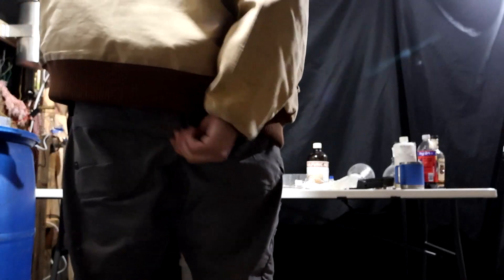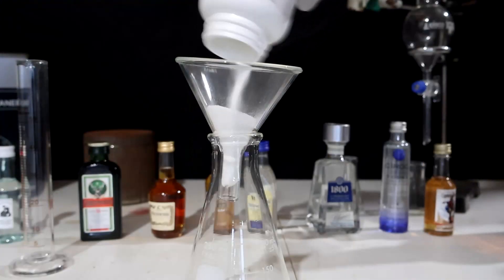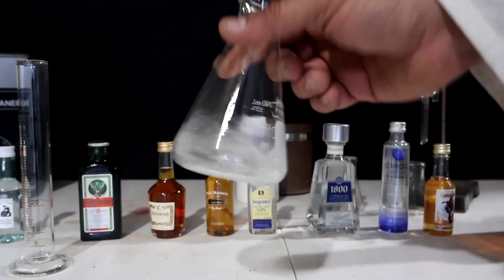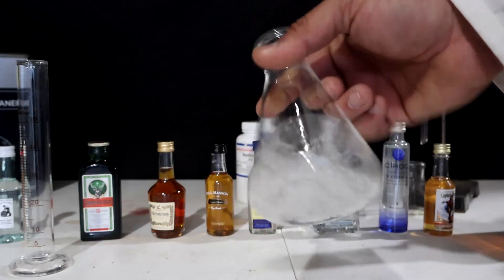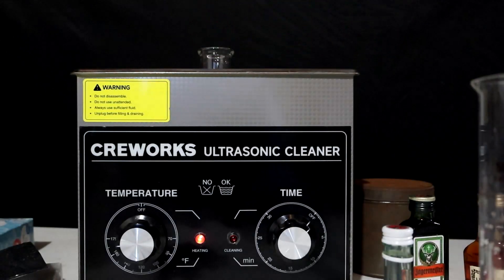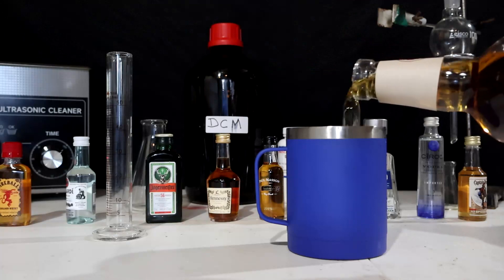This bottom layer is then filtered on dry sodium sulfate to remove as much water as possible before evaporating most of the DCM since it is more volatile. This has the effect of concentrating the extract for analysis.